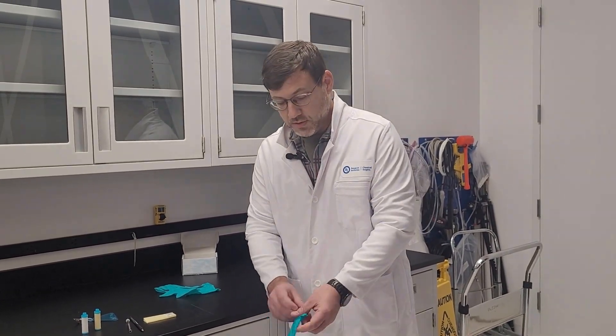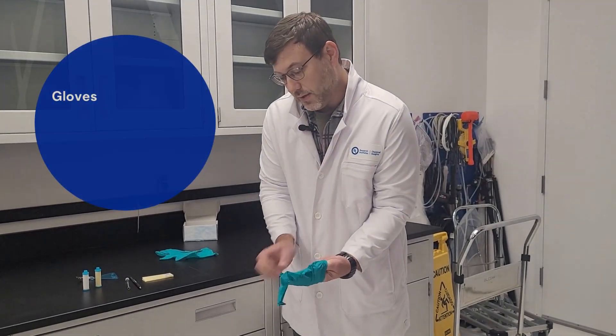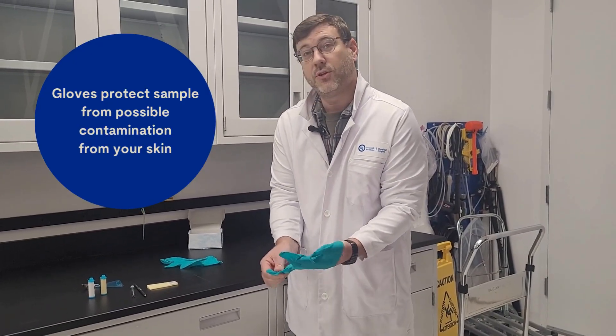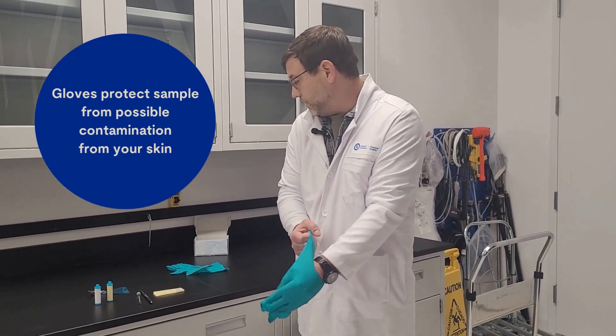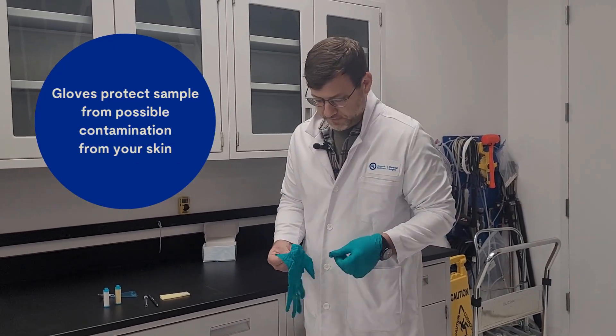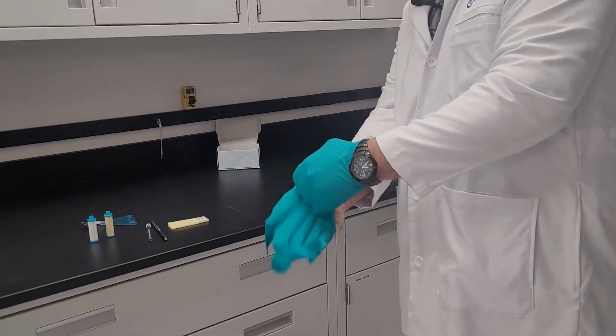So the most important thing we should do to start is put our gloves on and the reason why we put our gloves on is not because of concern of hazard to your health but to protect our sample. We're going to get our gloves on and now we're going to start our passive samplers.